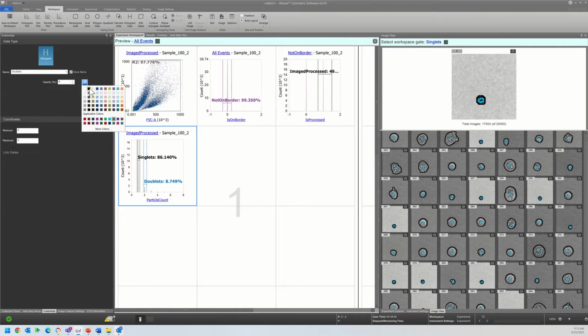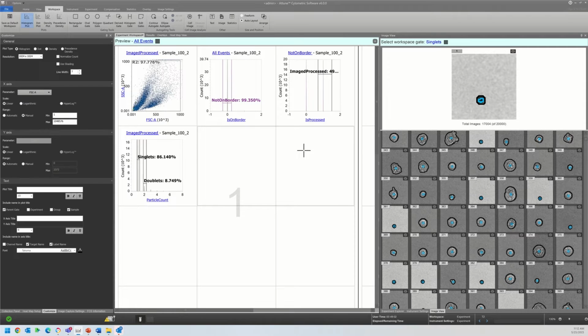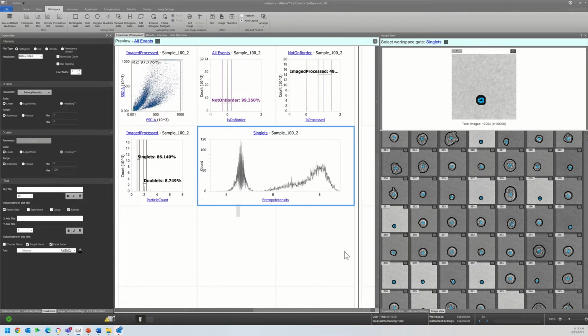And this is where a lot of people start to get hung up on what parameters are best to start with and how to begin applying them. There's a couple different ways to do this, but one of the most useful ways, if you really are unsure which ones to begin applying, is to look for some resolution on histograms between different parameters. So if I was going to look for a potential parameter to use analyzing the sample, I would set my gate, and I would come in here and potentially compare entropy intensity.